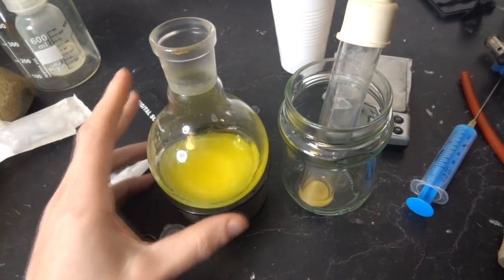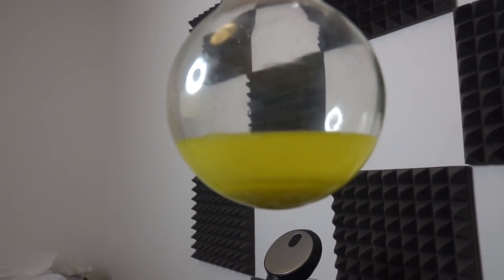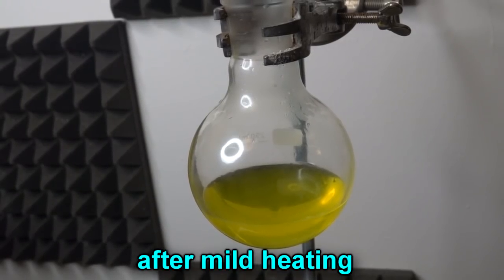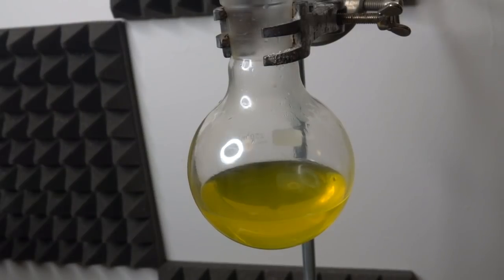So that's what it looks like the next day. Just about to see the crystals. Well first of all I'm going to heat it up, see if it all goes back into solution. So we've got a nice yellow solution now. But now I'm going to add some hydrogen peroxide, fairly concentrated stuff, 30% hydrogen peroxide. Let's go for 15 shall we. Then we're going to get some precipitate of uranium peroxide here, which is the first step towards getting something sensible which I might be able to electrolyze to make metallic uranium.